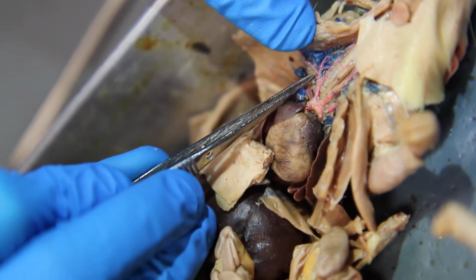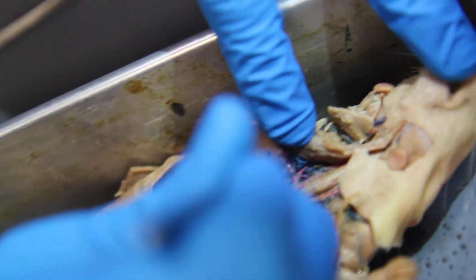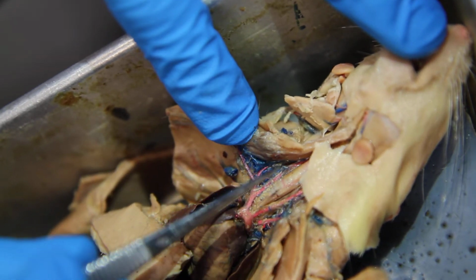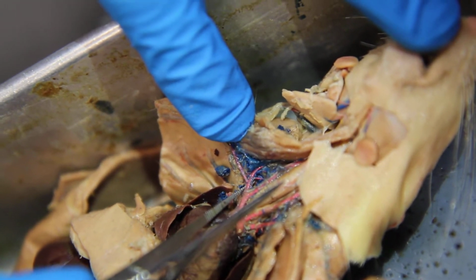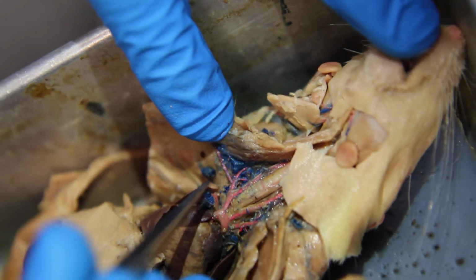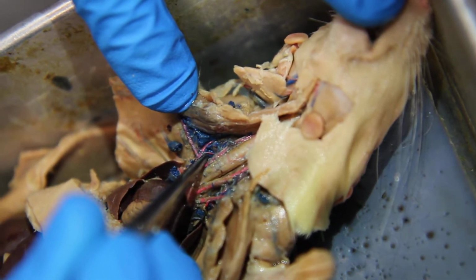Yeah, okay. You're probably not going to be able to see it on the camera, but it's going this way, dorsally, like into the rat. It's right there. I could barely see it. That little tiny thing? That's called the costocervical artery. And then there's one that's going up and back, and that's that little one right there. That's the vertebral artery.